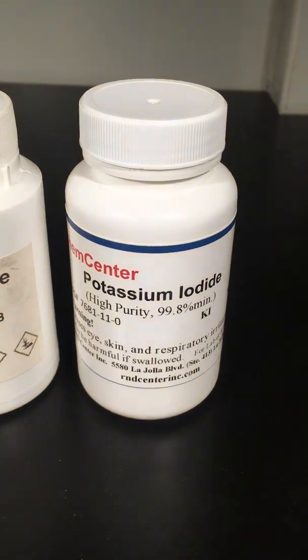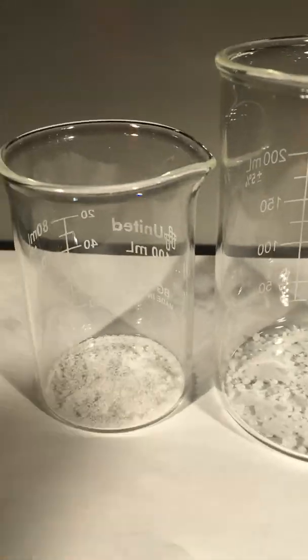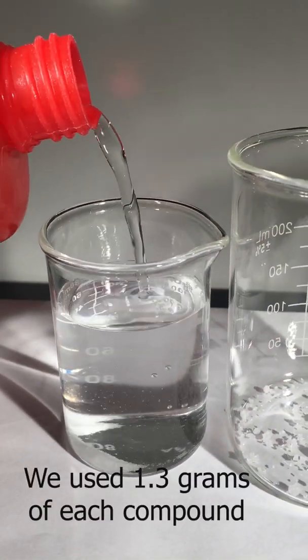Lead nitrate and potassium iodide. Both of them dissolve in the water, but this is only a physical change.